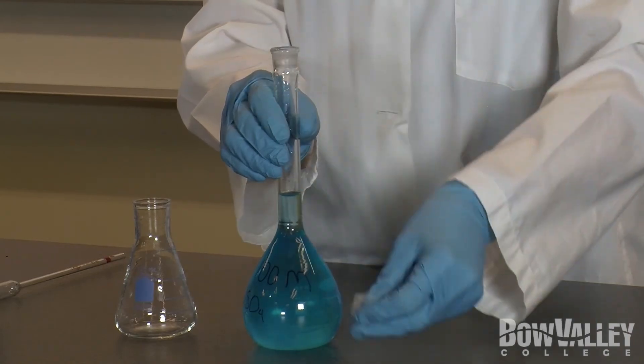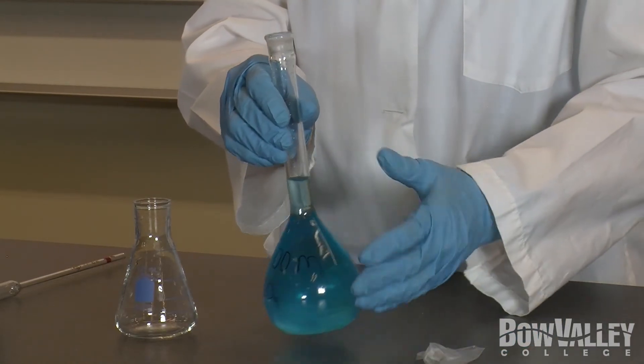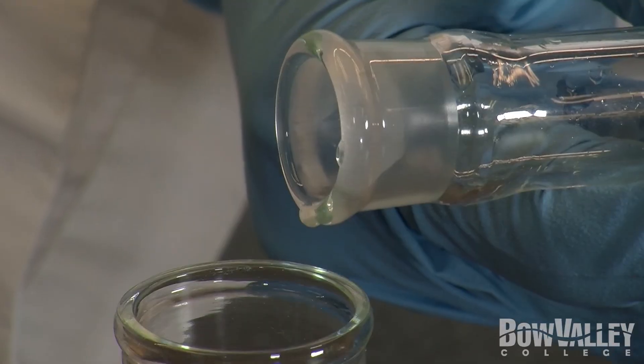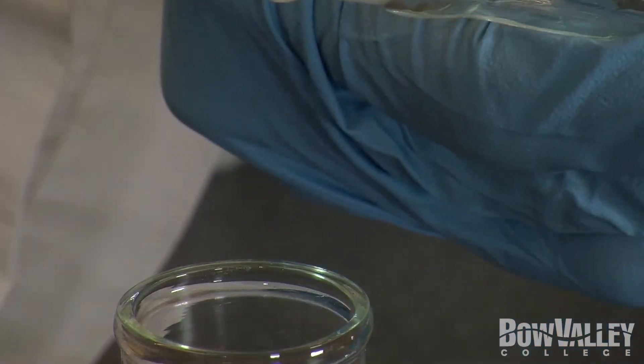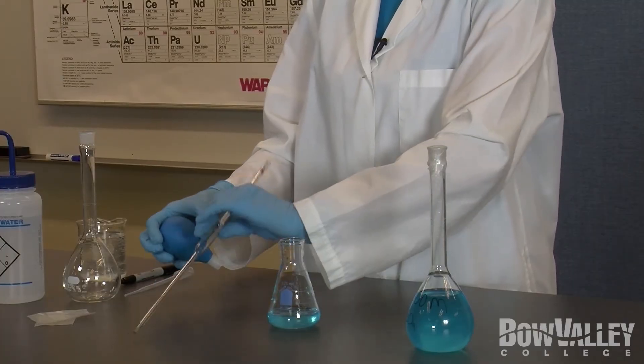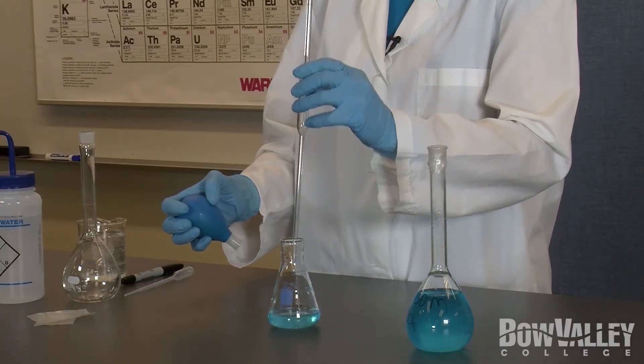Here is our stock solution. We do not want to contaminate it by directly inserting our pipette, so a small amount is first transferred to an Erlenmeyer flask. To use the pipette, place the end in the liquid to be collected.